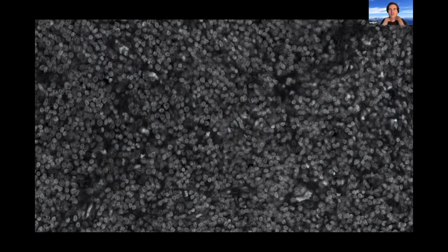That's a good question. It kind of pertains to the question of inter-rater variability anyhow. If you give, for instance, this crop to 3 different people and ask them to annotate it, what are the differences between those 3 annotations? I guess in this case, probably 10% of the cell masks would differ, say some is a cell in the background, as you mentioned.